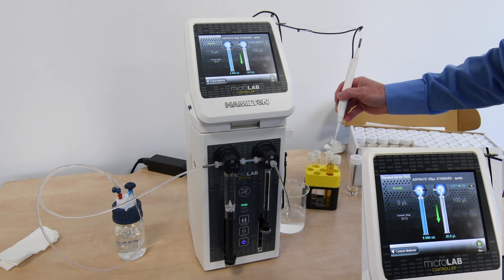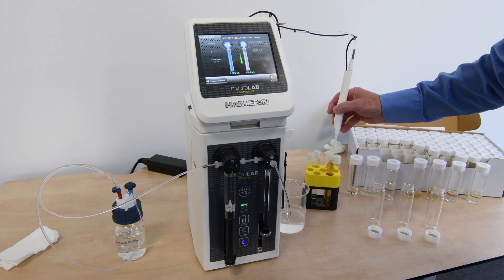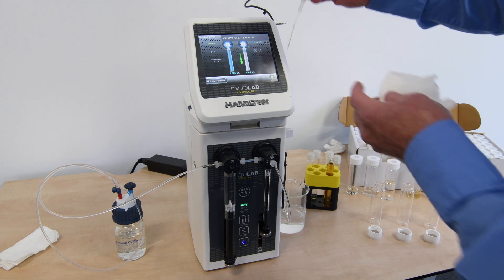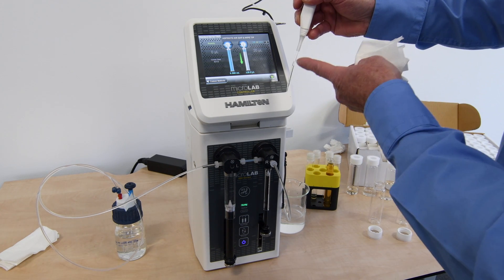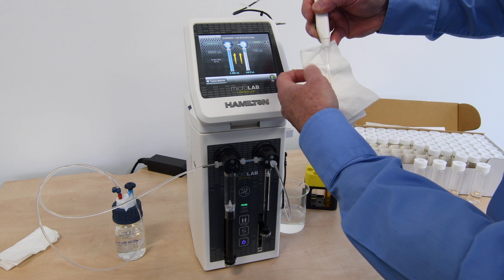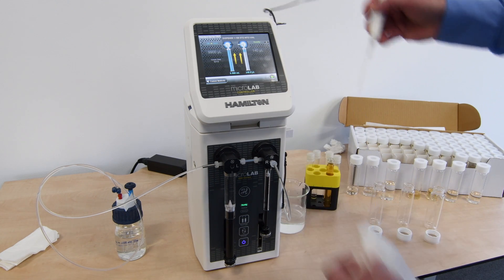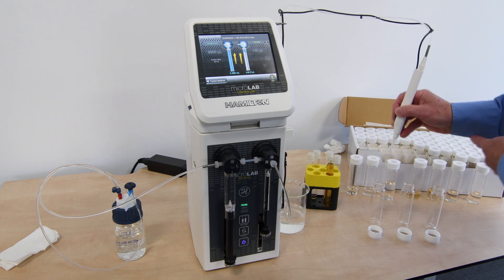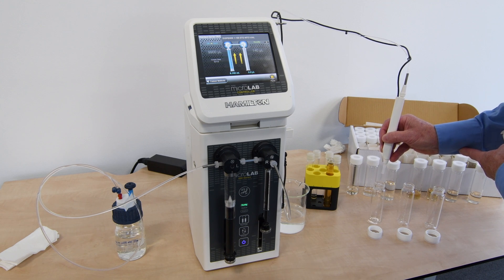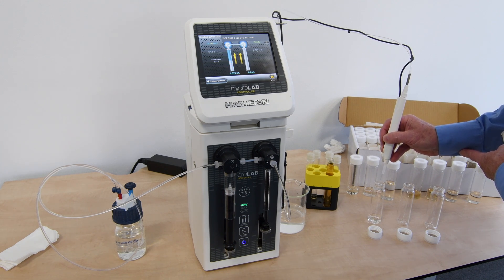It's ready now to aspirate 100 microlitres — aspirating 100 microlitres of the qwerty standard. I'm going to pick that up from our standard set. You can see the air gap pick-up again, small air gap. I can wipe the tip, and now dispensing — I've produced the first standard, which is my 1 in 100 dilution.